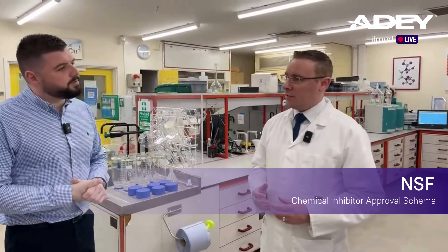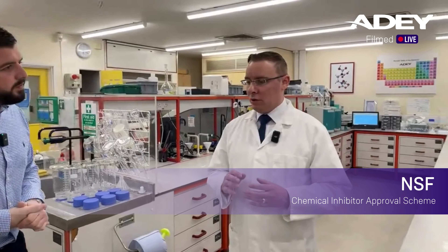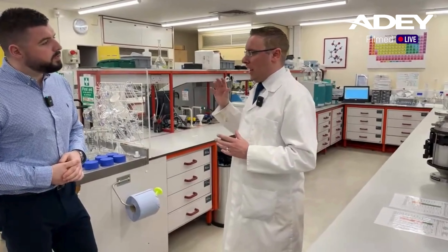So the NSF testing comprises of three parts. The first part is the performance of the corrosion inhibition. The second part is the inhibition of scale formation. And the third part is how the chemical will interact with any rubber components - i.e. O-rings, gaskets, etc. When we batch test, we test every batch of MC1 Plus here at the lab for the corrosion performance testing. We can then see and ascertain how each batch will perform in a corrosion environment. We can then ascertain if the product has changed through batches and keep our batch control quite tight. We can trend the data over time to see how batches are varying.